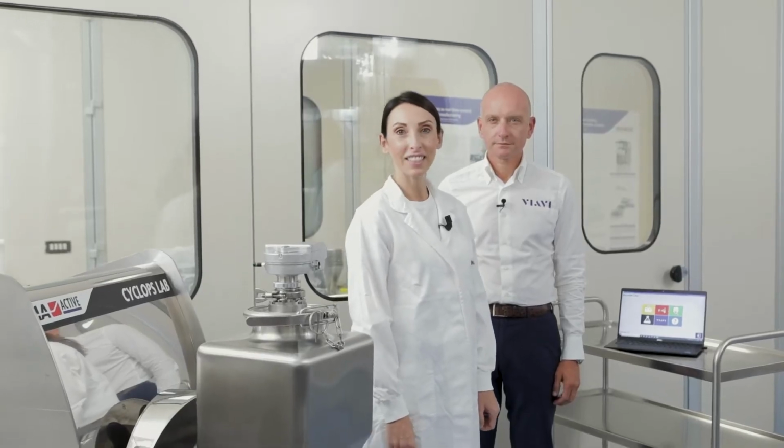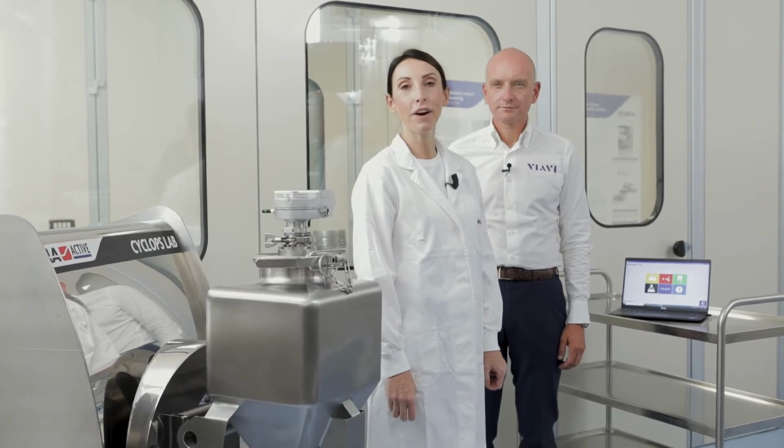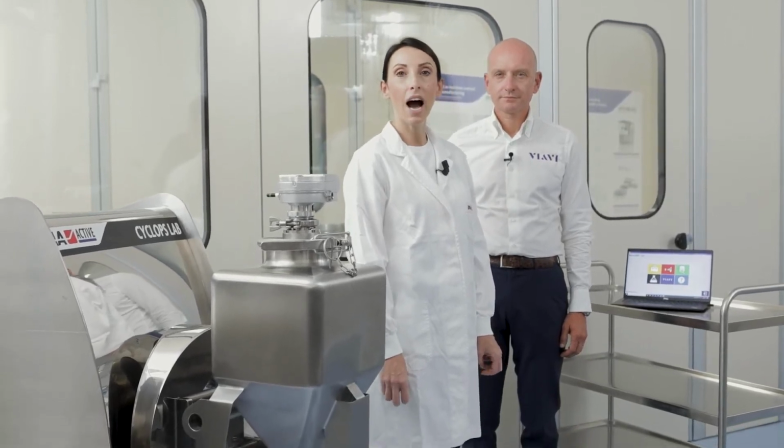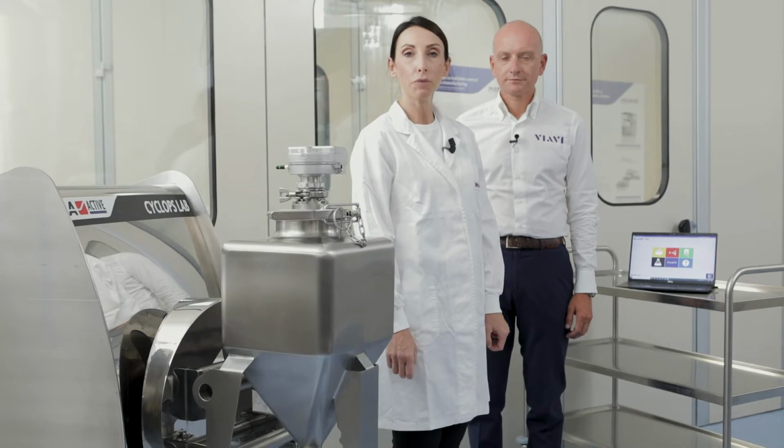In a lot of cases, it can happen that the blend is not as homogeneous as desired, and the final properties of the blend are not within specification. This, of course, can increase the time for both process and formulation development. One of the main advantages of having a NIR sensor installed on a blender is the possibility to determine in real time the raw material critical quality attributes.